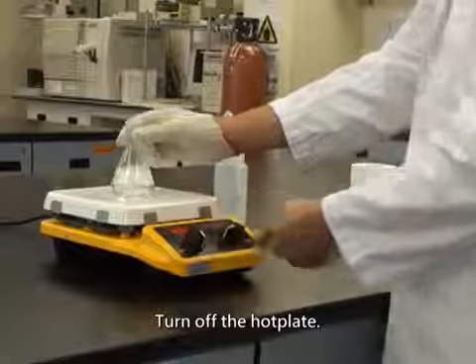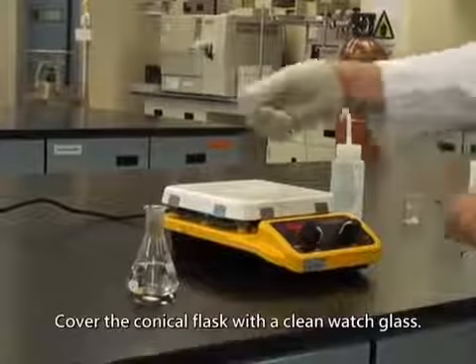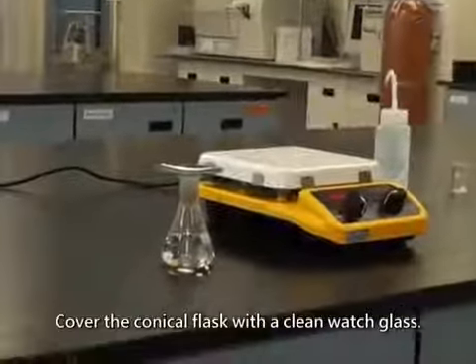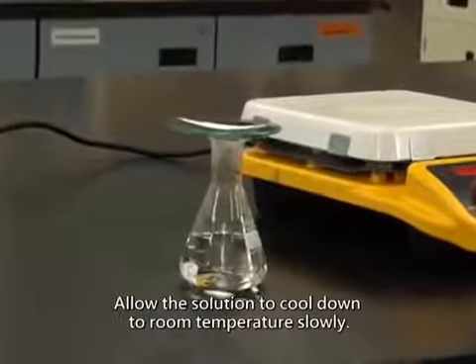Turn off the hot plate. Place the flask on the bench. Cover the conical flask with a clean watch glass. Allow the solution to cool down to room temperature slowly.